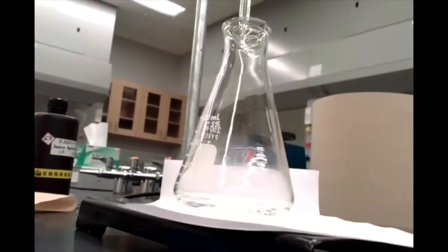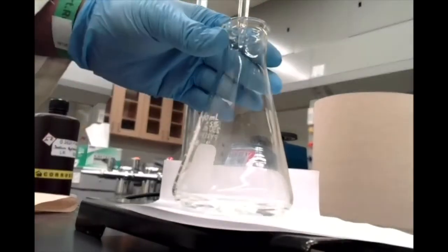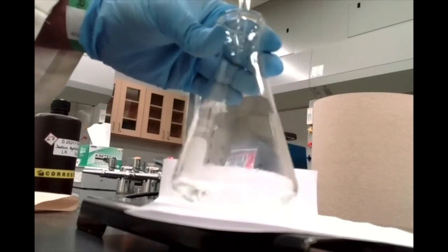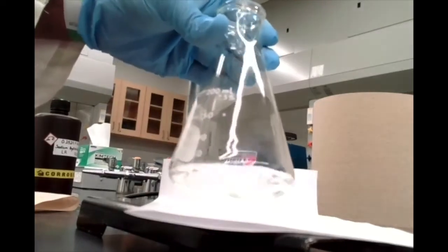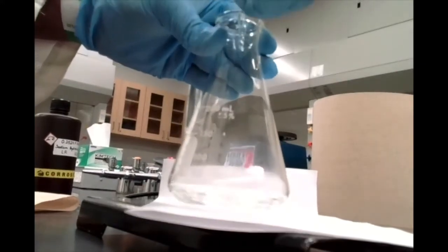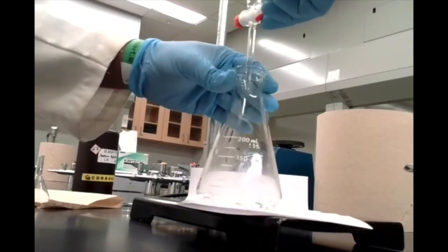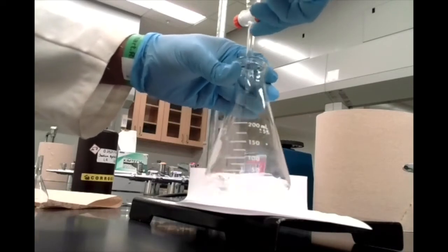So let's continue adding some sodium hydroxide, but let's be very careful here about how much we're adding. So I'm going to add, again, probably about a drop at a time. Whoops, maybe slow that down a little bit. Okay. And again, you can see how quickly the pink color disappears as I'm swirling here. If I pull this back a little bit, you can see me holding onto, I've got my hand ready to stop the flow of sodium hydroxide as soon as I realize the endpoint's close.